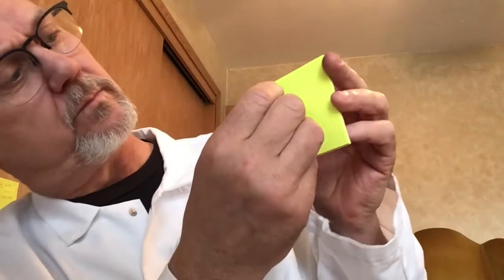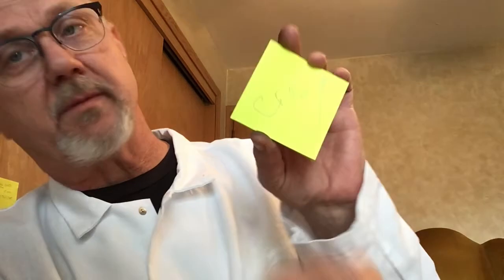It almost feels greasy, so I'd say greasy feel. It definitely feels like grease. Oh, look at my fingers. Weird. That's crazy. Let's do this. There we go. That's crazy, man. What is that stuff? Crazy. Look at it writes. Wow, crazy. Okay, moving on.